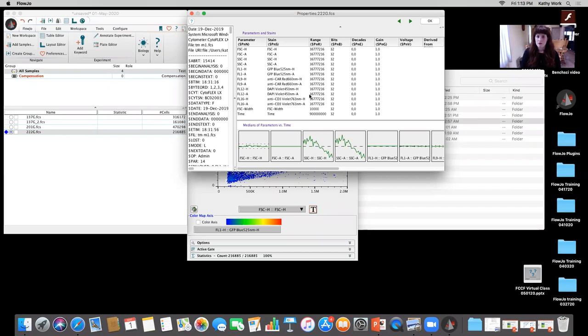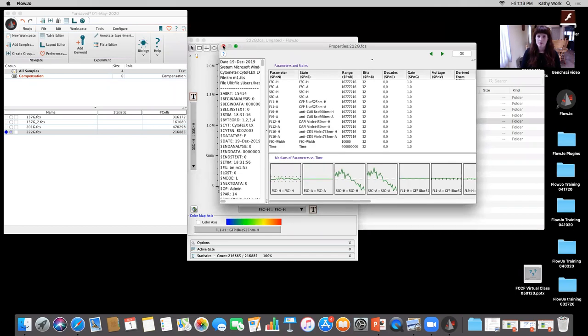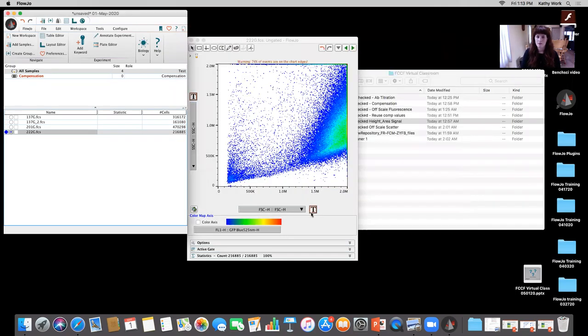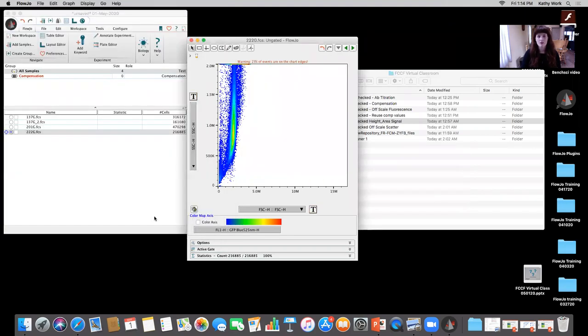And I have two options now that I know that that value is higher, right? So it's 16,777,216. I could either come here to the transform button, customize the axis, and change this value to 16,777,216. The reason I don't always prefer that, excuse me, is because then I'd have to go in and change every single detector via the transform button. Okay, so I don't prefer that.